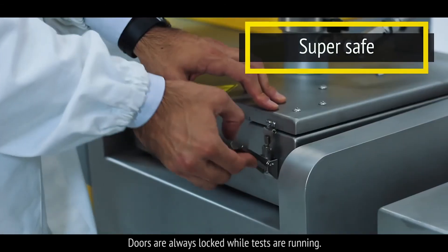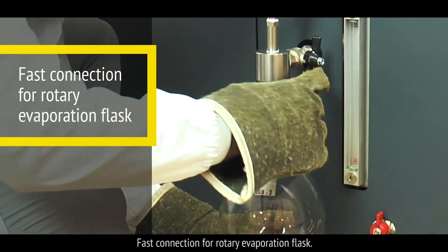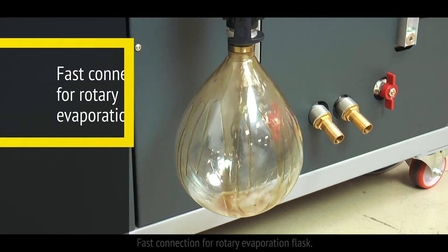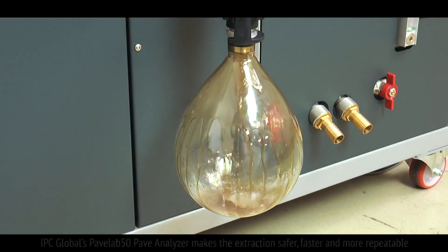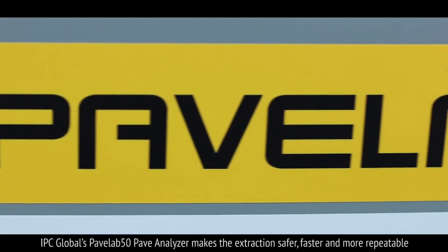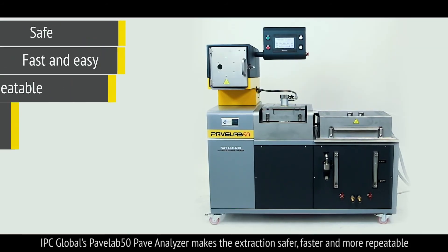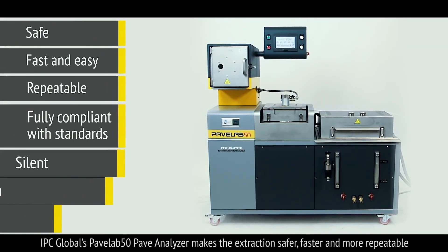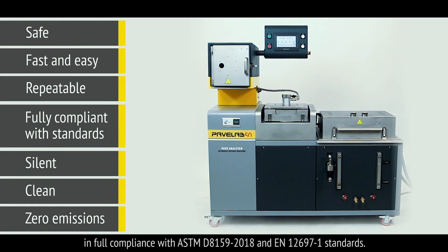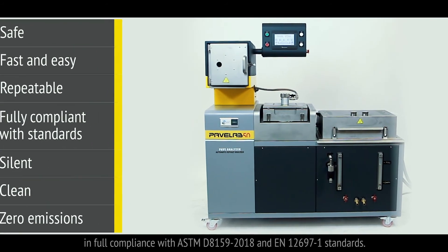Doors are always locked while tests are running. Connect your rotary evaporation flask quickly. IPC Global's PaveLab 50 Pave Analyzer makes the extraction safer, faster and more repeatable in full compliance with the relevant ASTM and EN standards.